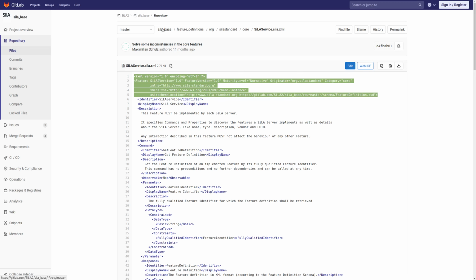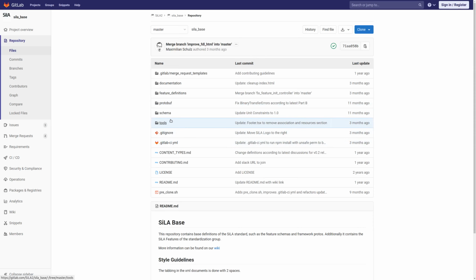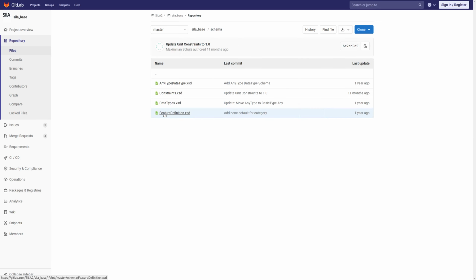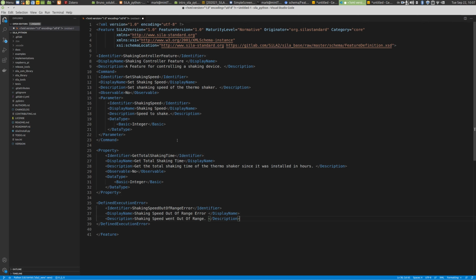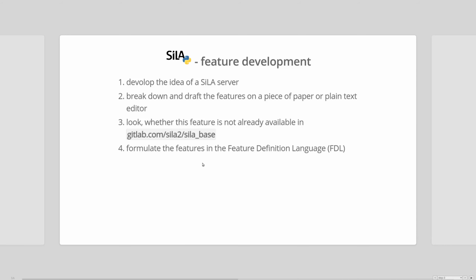So let's go back to SiLA base, and then here is a schema folder, and here's a feature definition schema, and this can be used to validate the XML file for the feature definition. Okay, so this feature here. So just save that, and then the next steps will be explained in the next tutorial about how to process this feature definition language file.